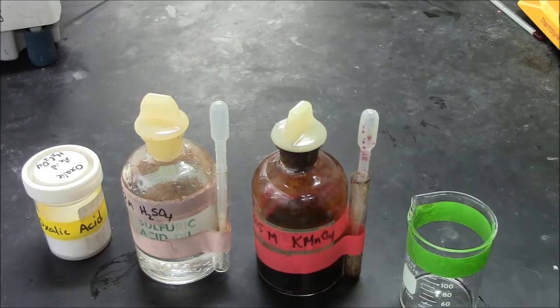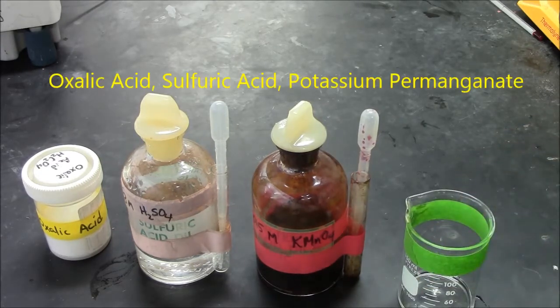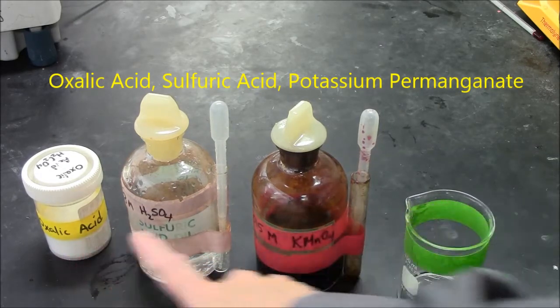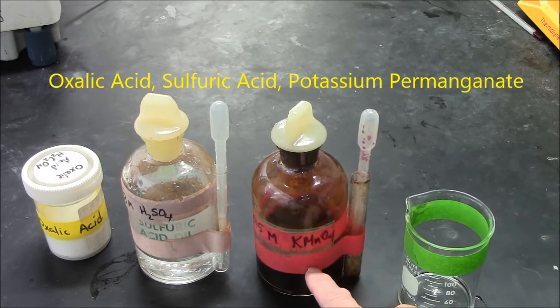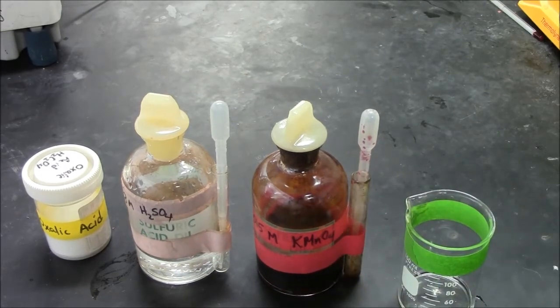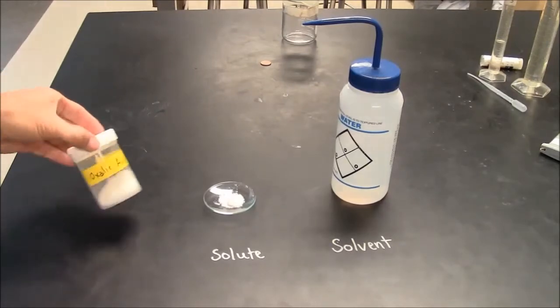In the color by number lab, you'll run reactions in a beaker, but they'll be a little different than you're used to because you'll have 3 reactants: oxalic acid, sulfuric acid, and potassium permanganate.